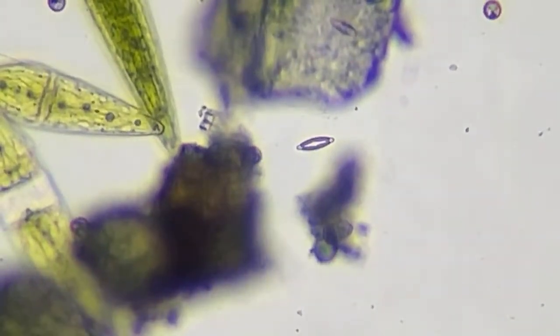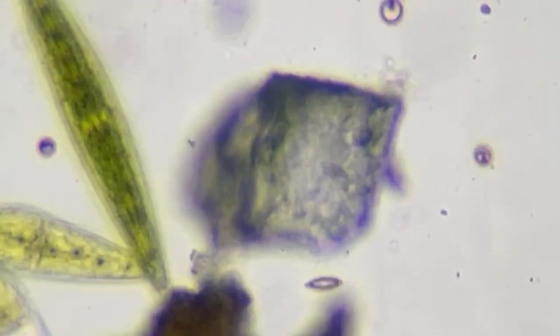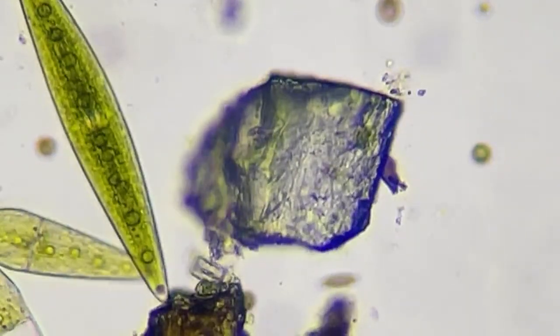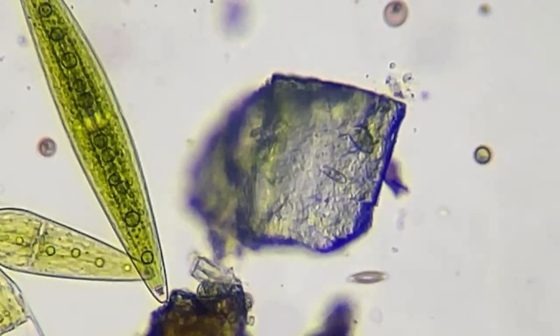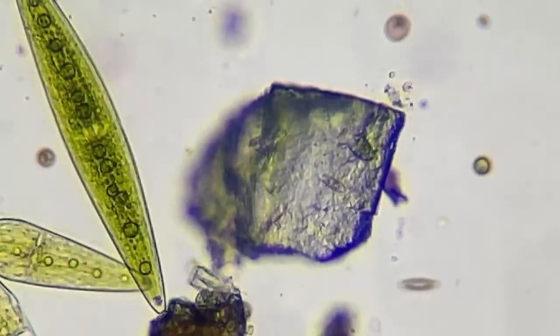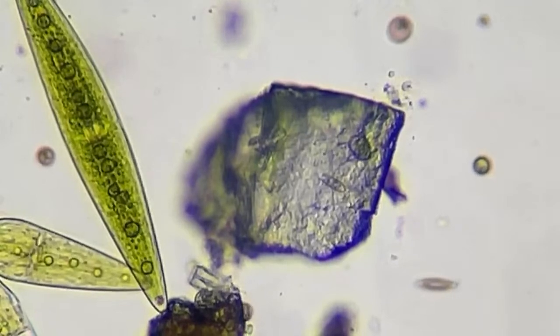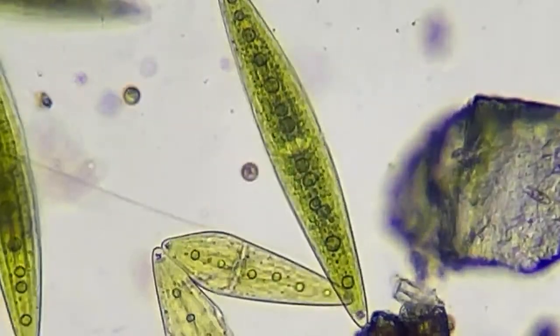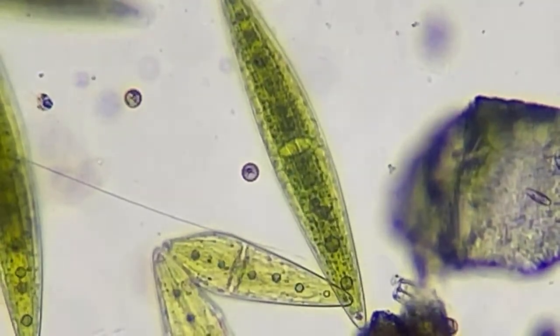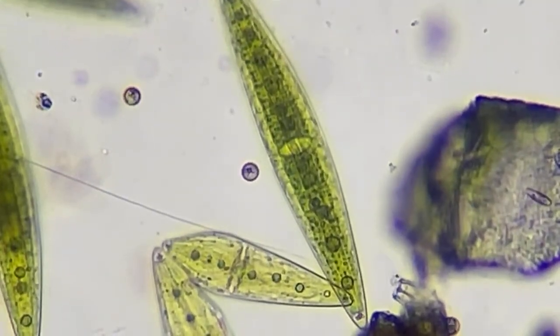There's another diatom. And if you look in relation to a grain of sand, okay, or a grain of dirt, that would be a grain of dirt. And if you ever get dirt mouth, I don't know, when you're a kid and it's kind of gritty, it's a little gritty, that's why, because it's this stuff. And I don't have the knowledge to know what this little tiny guy is, but he's tiny.